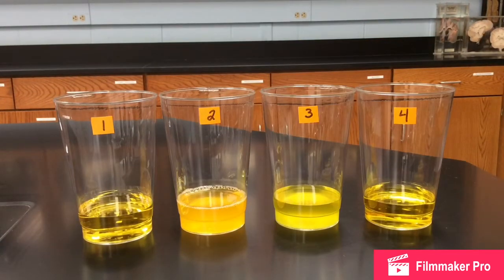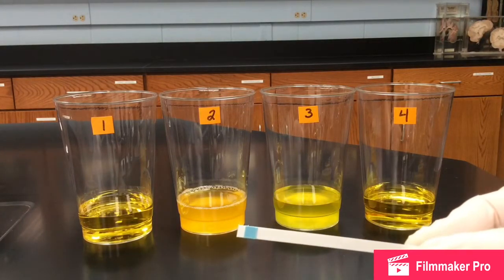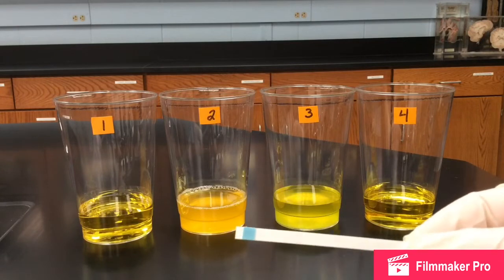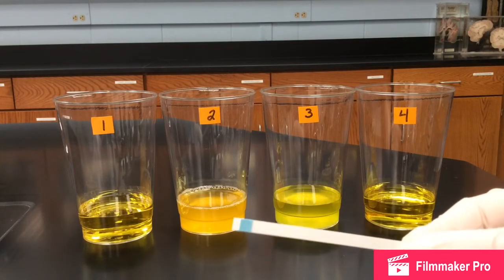Okay, so now we're going to test each patient's sample for sugar. We're going to do it a little bit differently than the directions say to. Rather than heating up water and using Benedict's test, just for simplicity's sake, we are going to use glucose strips, as we did in the dialysis test. Again, I will upload a picture of the glucose scale so you can tell what is negative and what is positive.